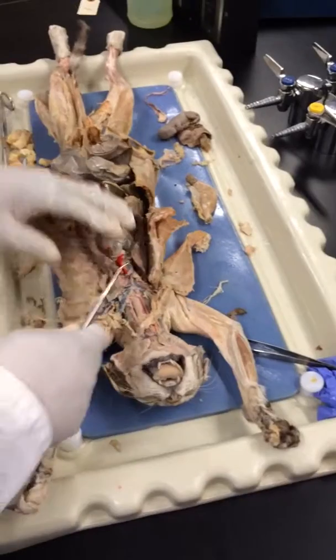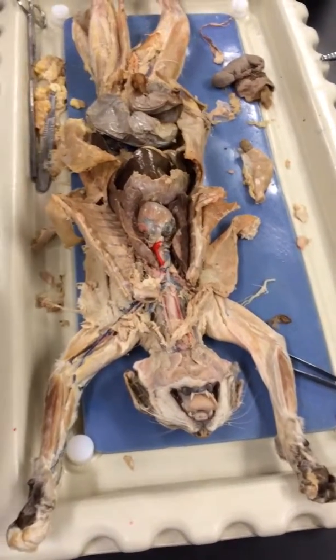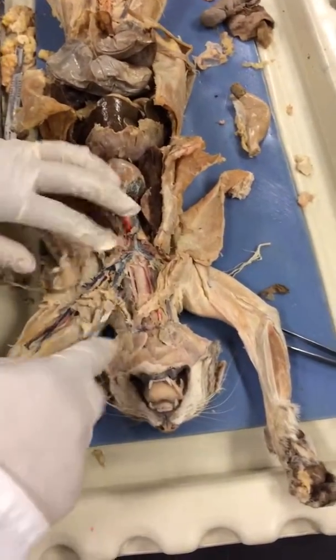I could send. Alright, so this is going to be good, because if you can identify it on this cat, then you'll be able to really identify it on a trash cat. It's okay. It still has connective tissue though.